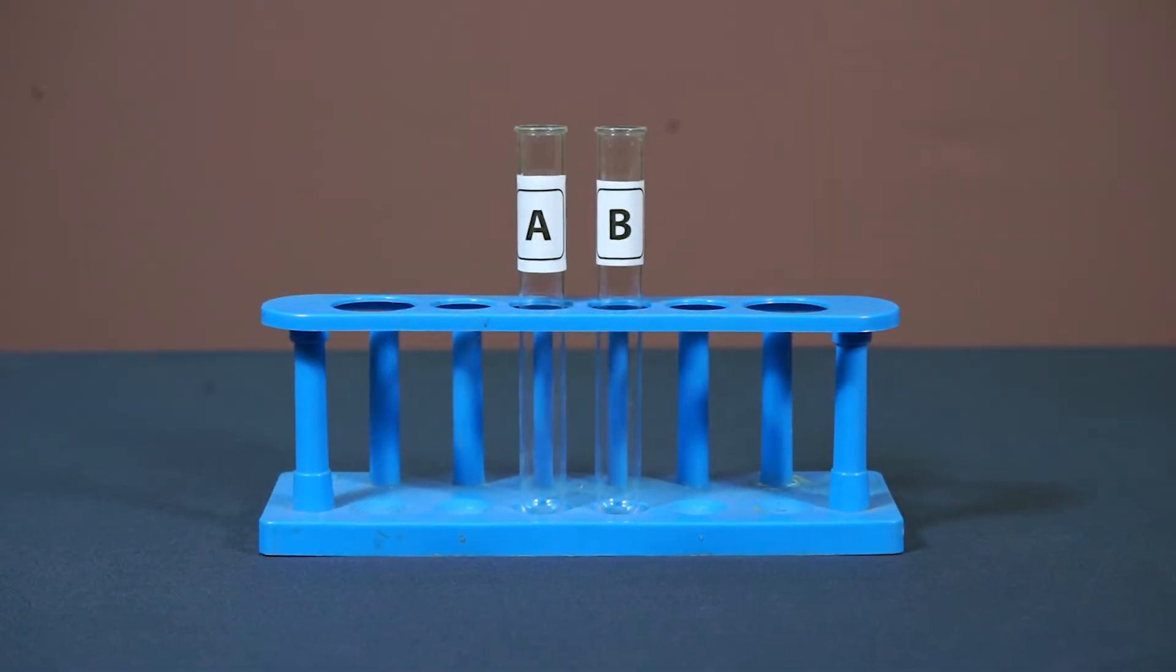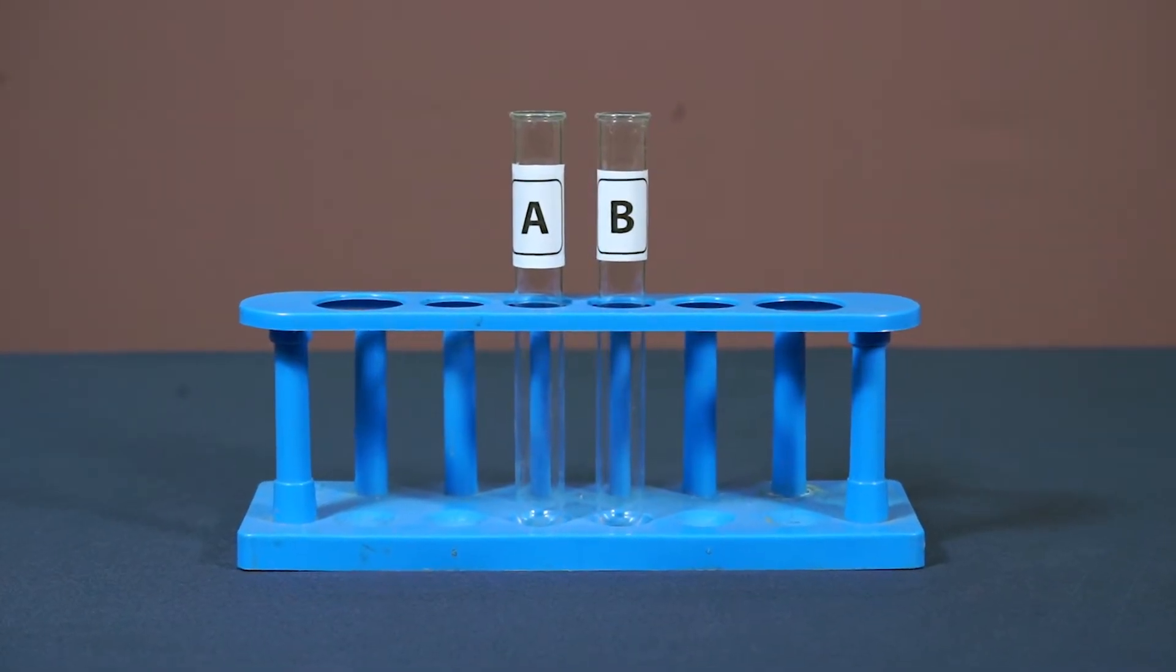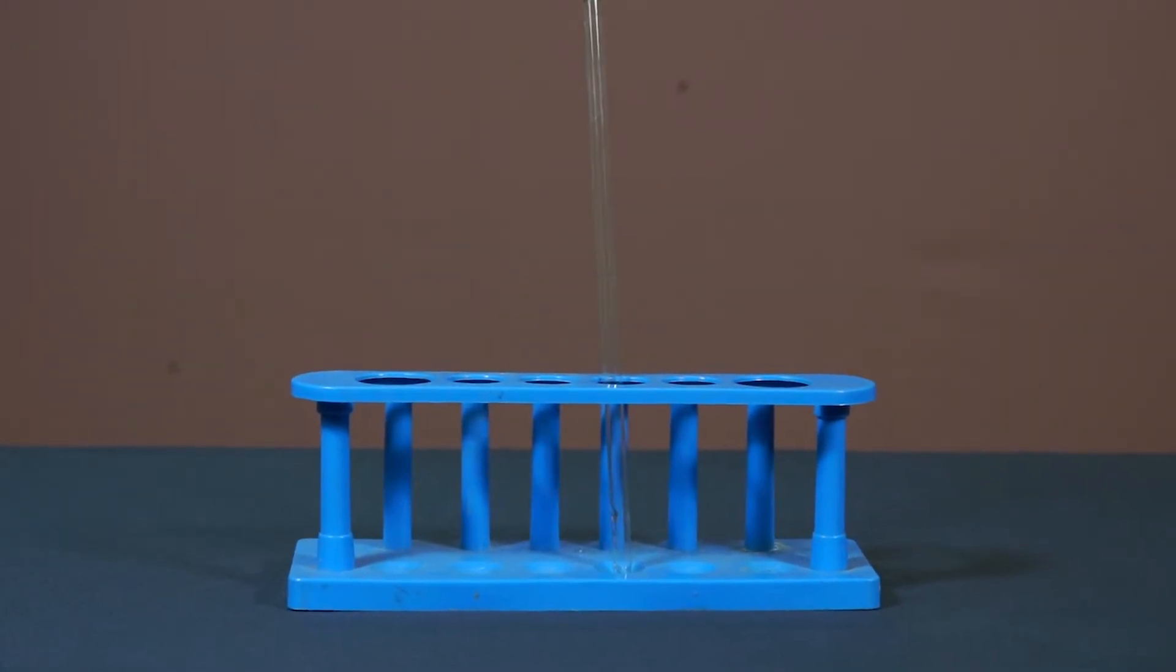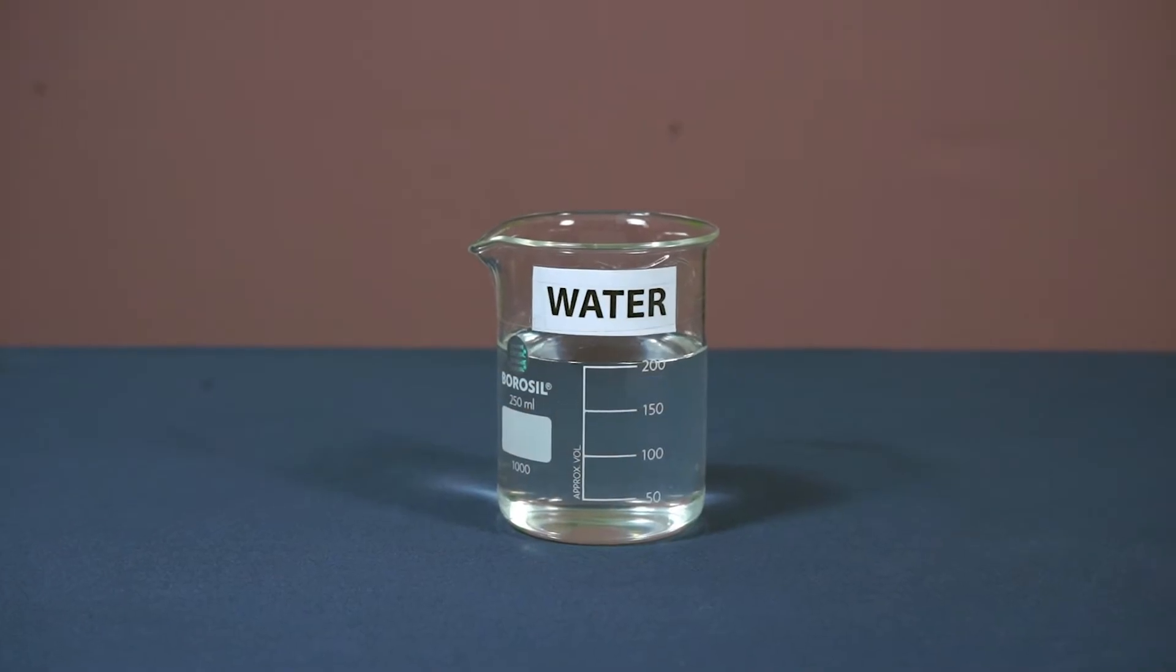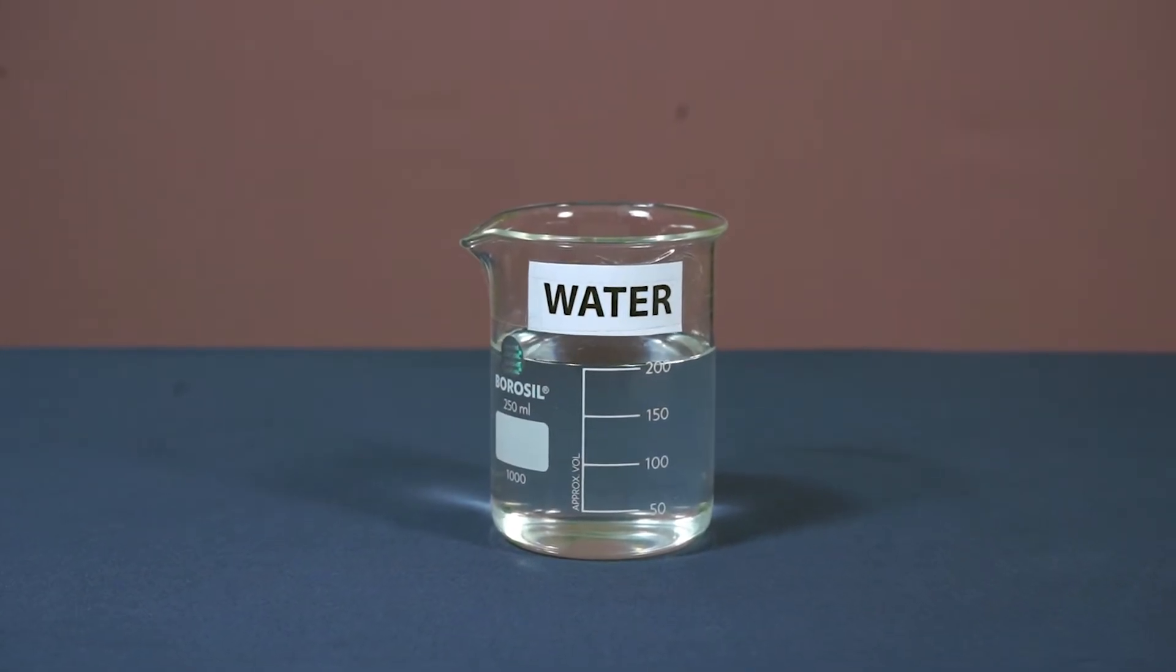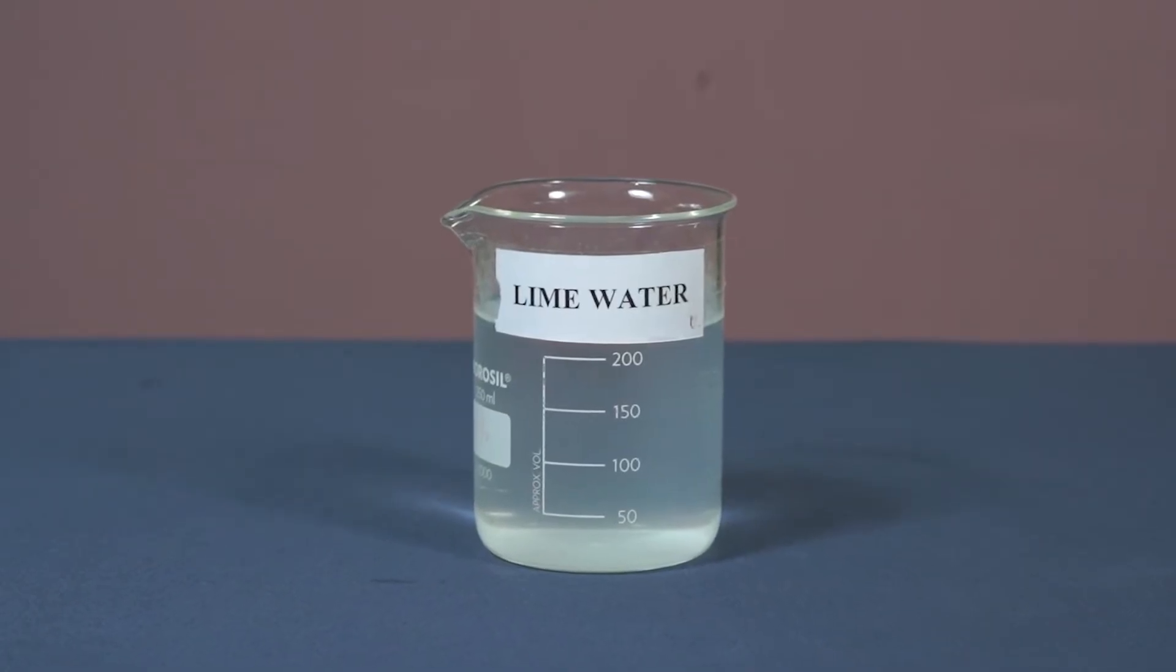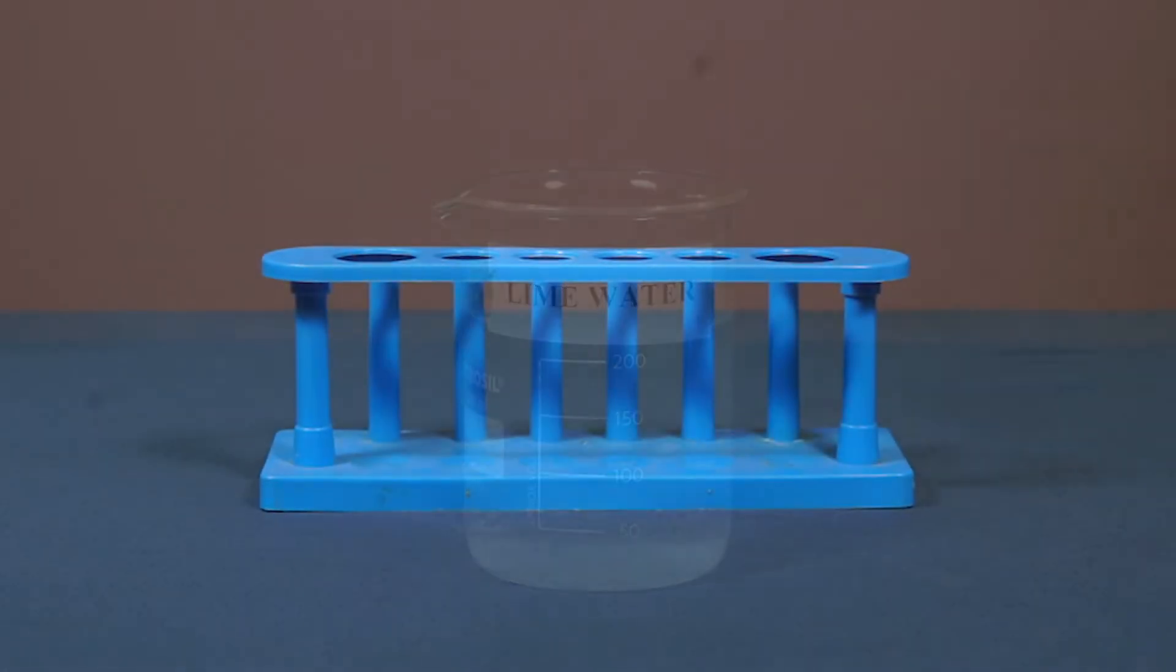Two test tubes, thin glass tube straw, water, lime water, test tube stand.